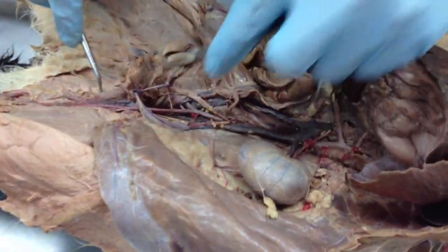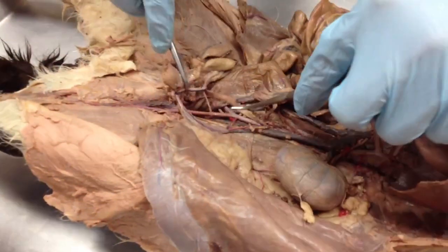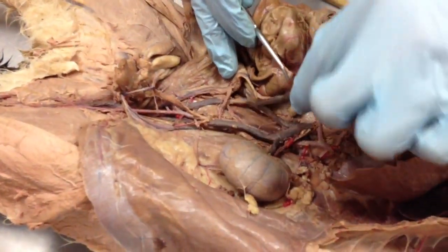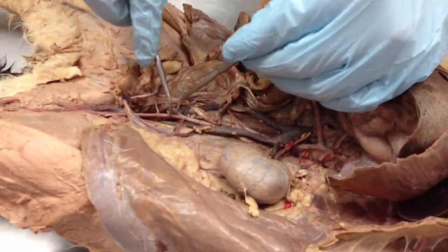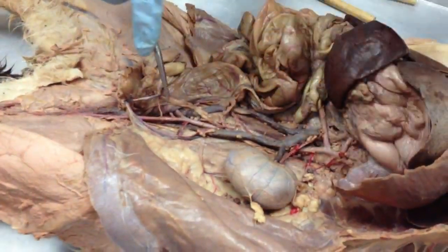And then comes the femoral vein, so you see the femoral vein just continue on down there. Keep in mind that's kind of weird, but if you think about the artery as far as the iliac, it makes more sense because you can use that as a guide to get your bearings. So iliac vein or artery in that area.